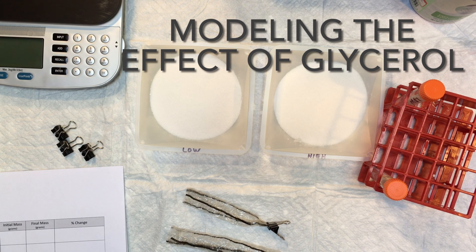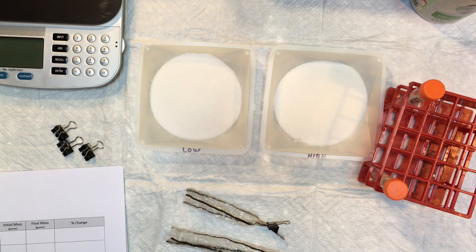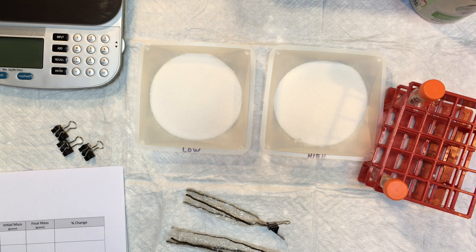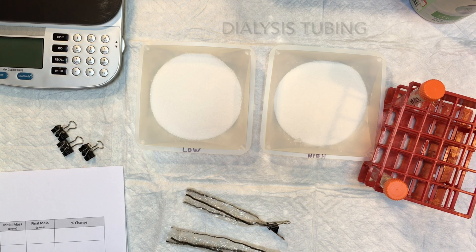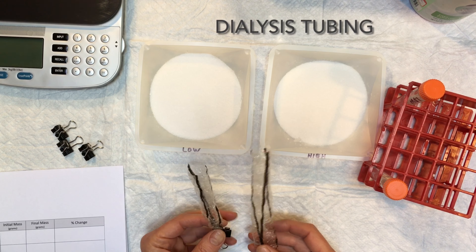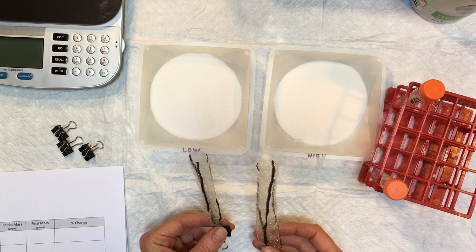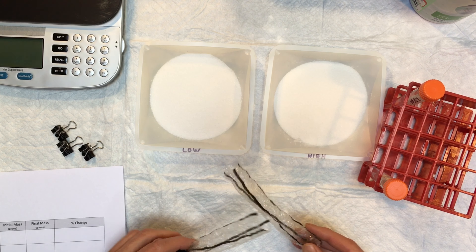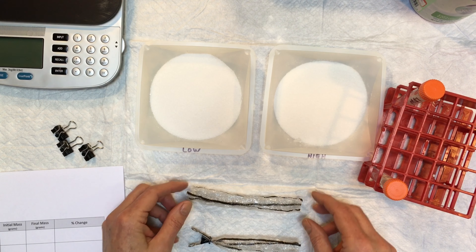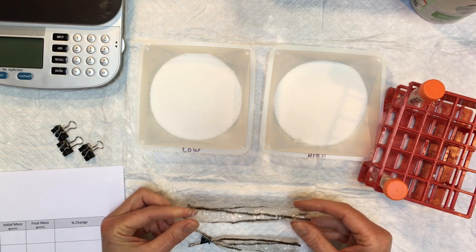Hi, we're going to run an experiment that models the wild type and the mutant worms in a high salt environment. For this experiment we are going to need two dialysis tubes, which is a semi-permeable membrane that allows water to pass through freely but not larger molecules like glycerol. These basically represent the skin of the worm.